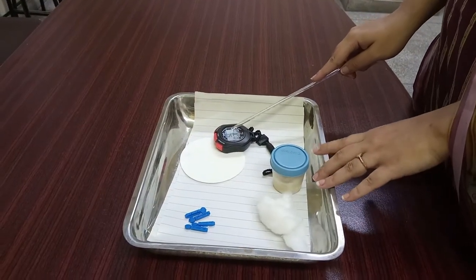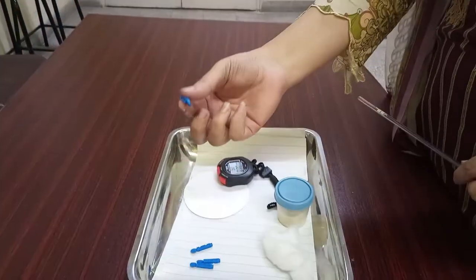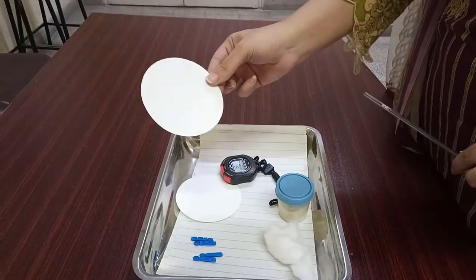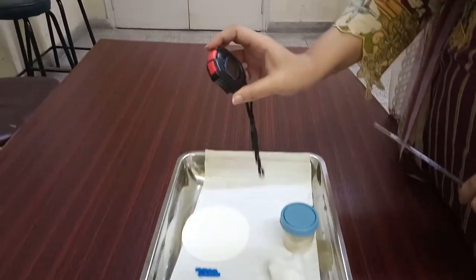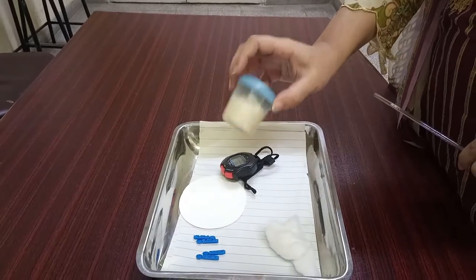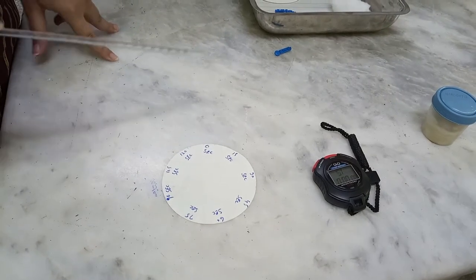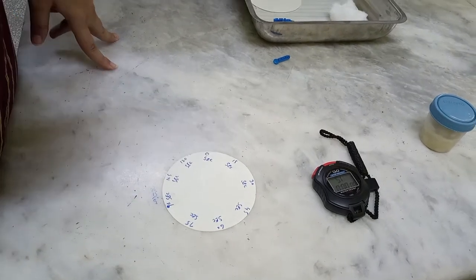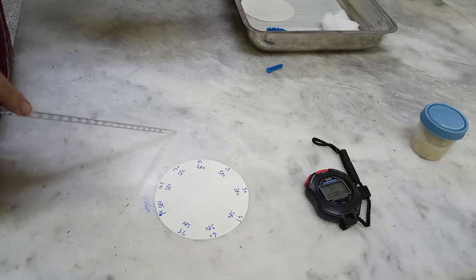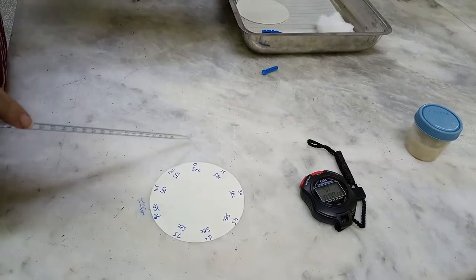What you need to calculate the bleeding time: a sterile pricking needle, a filter paper, a stopwatch, and a spirit swab. To start the practical, first we have to take consent from the subject. We will introduce ourselves, explain the procedure to the subject, and after his or her consent, we will start the experiment.